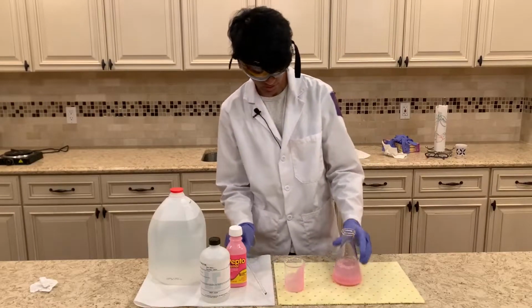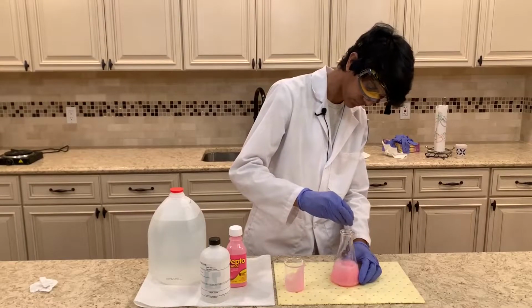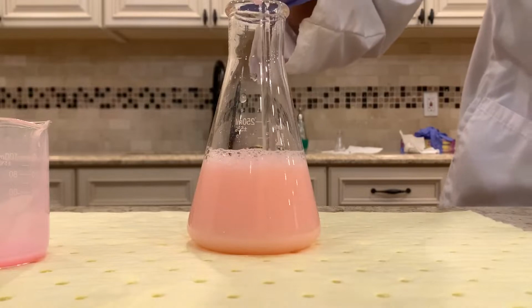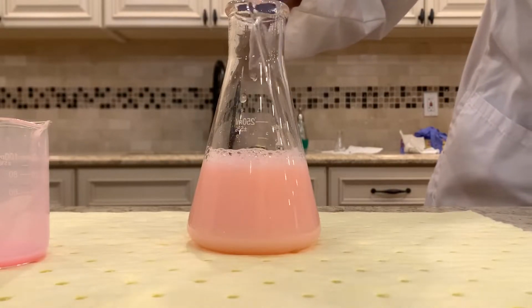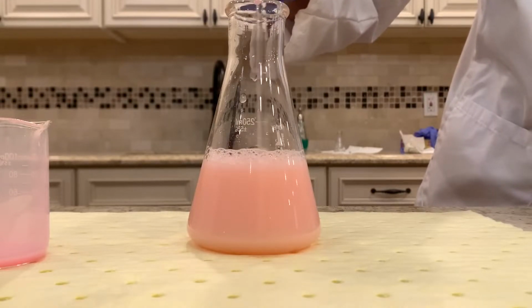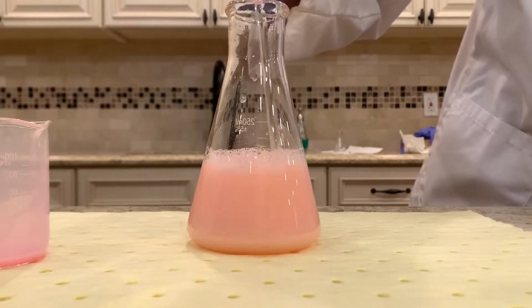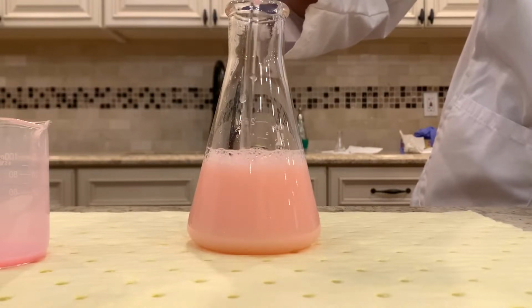Okay, and for this reaction to take place, I'm going to start mixing this a little bit. So the reaction is starting to bubble up and become a little bit of a cloudy color now. Hopefully some bismuth chloride is beginning to form. I'm just going to let this sit for a little bit and keep on mixing it to let the reaction go to completion.